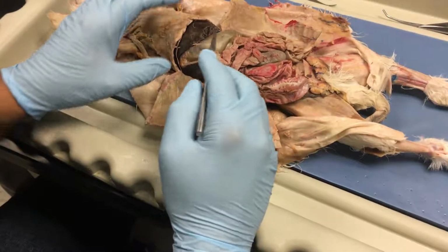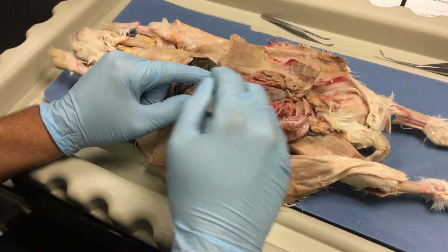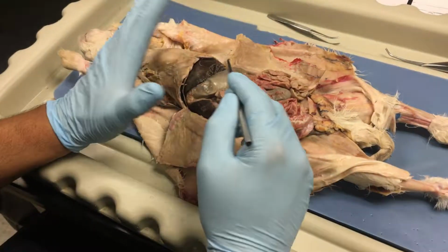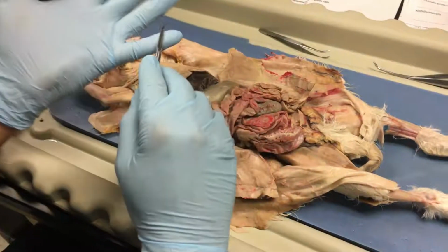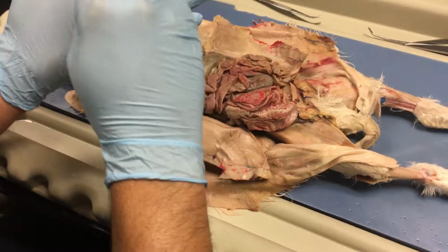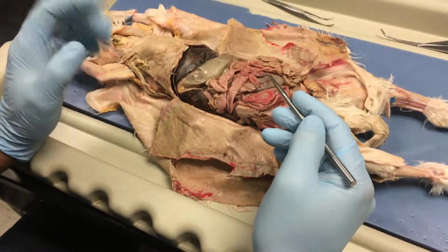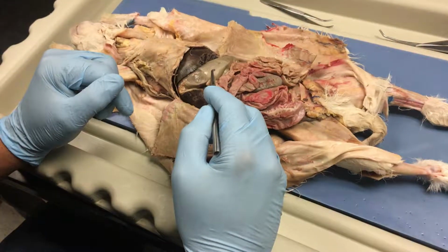Now each one of these organs has an outermost covering. It's not a separate membrane, it's just the outermost covering of the organ called visceral peritoneum, also known as, do you guys remember that? Serosa, the serosa. Remember, mucosa, submucosa, muscularis, and serosa. But for the lab practical, it sounds like you guys all know visceral peritoneum, which is what I want you guys to know. What's the main function of that? Produce fluids to reduce friction.